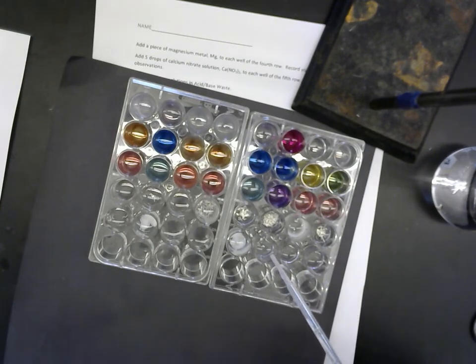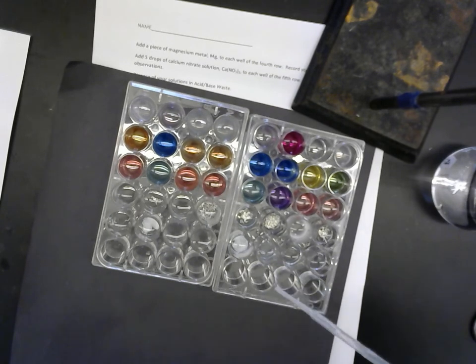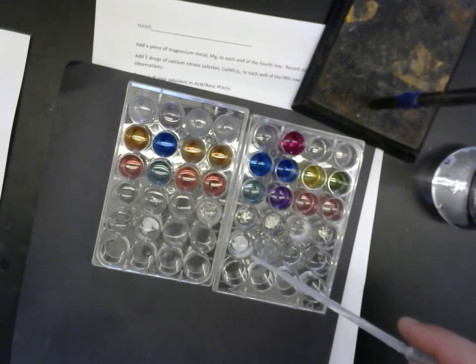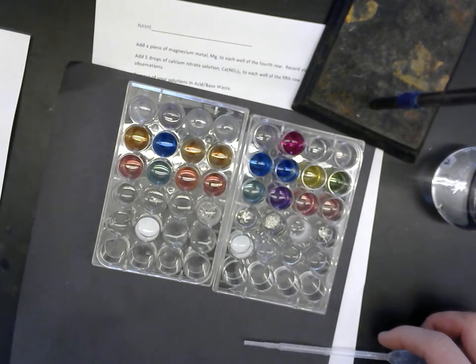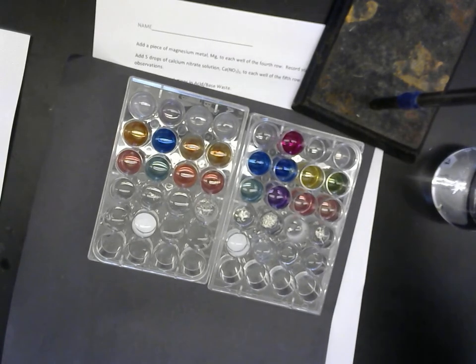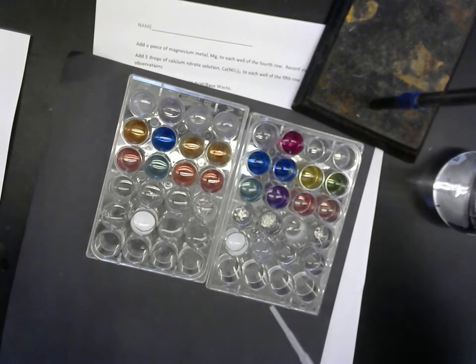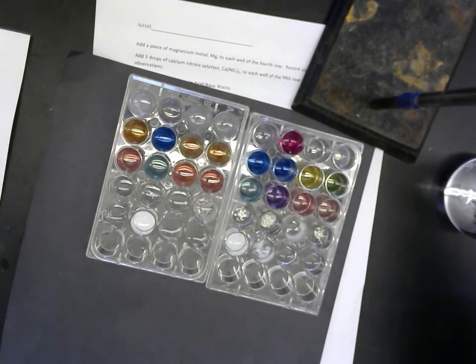That magnesium almost fooled me, because in the one when you put a lot, I thought it went over another row. So when I did that, I'm like, oh shoot! I just did the magnesium one now. So this one here, the calcium hydroxide, looks like I didn't tweak it quite well enough, so I'm going to cheat for you once again. That's what the calcium hydroxide is supposed to look like.